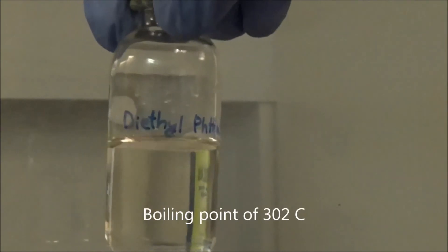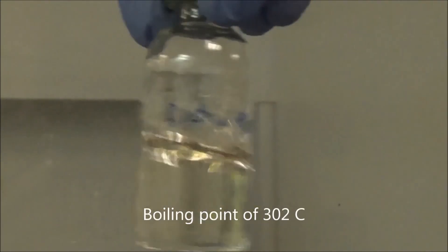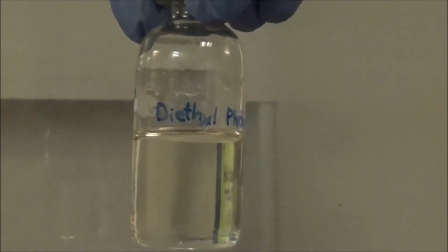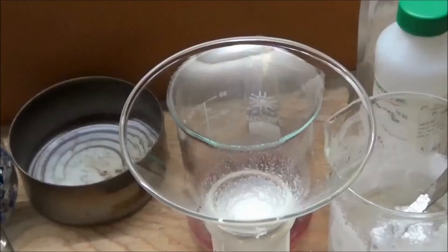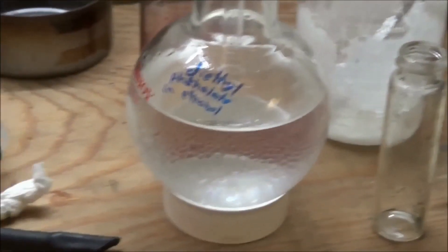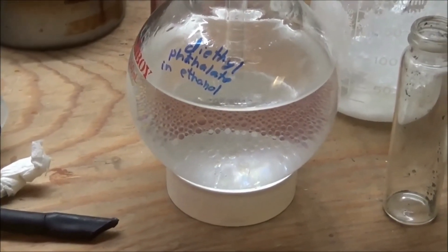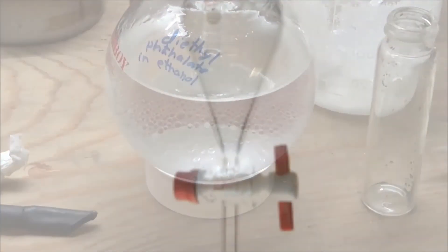Because of its high boiling point, I will distill it under vacuum in a future video. My low yield is due to three factors: one, I used too much drying agent; two, there were many transfer losses as you can see the droplets here in my waste; and an incident with a separatory funnel that involved my product spraying onto the bench.